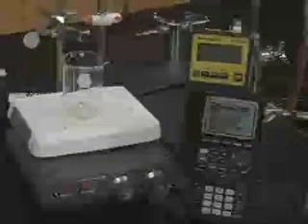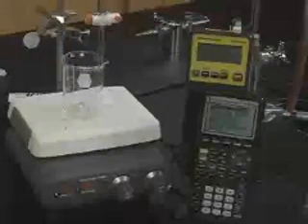We're going to do a titration of acetic acid with sodium hydroxide to generate the titration curve for a weak acid with a strong base. We're going to titrate a solution of approximately 0.1 molar acetic acid with approximately 0.2 molar sodium hydroxide. You will have the volume and the molarity of the acetic acid and the molarity of the sodium hydroxide solution. You want to calculate the equivalence point volume of sodium hydroxide and the half-equivalence point volume so that you can include those in the data points that you take.